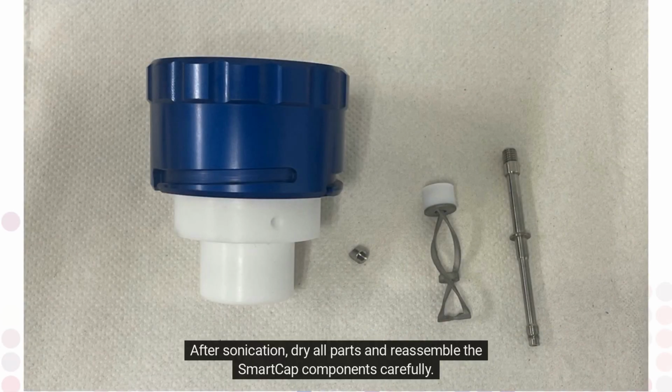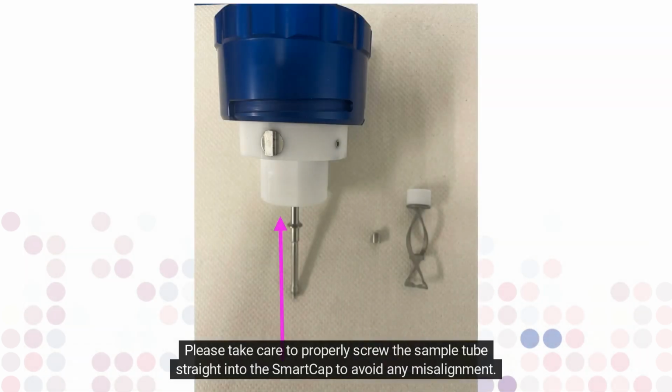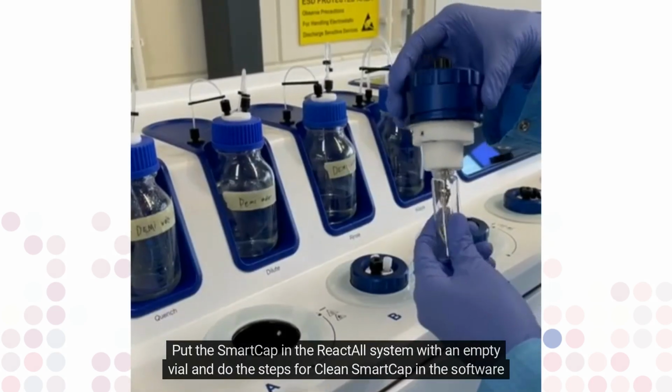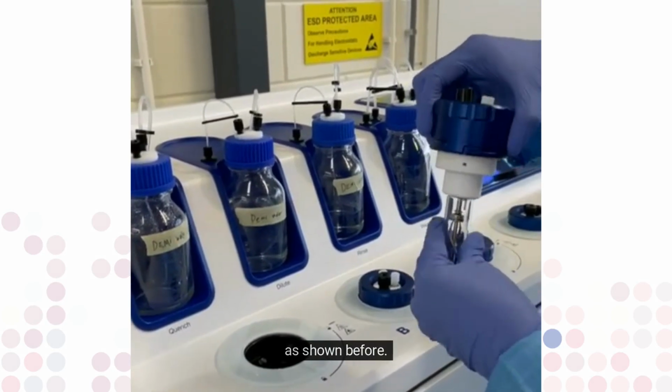After sonication, dry all parts and reassemble the SmartCap components carefully. Please take care to properly screw the sample tube straight into the SmartCap to avoid any misalignment. Also reassemble the overpressure cartridge holder and plugs. Put the SmartCap in the ReactALL system with an empty vial and do the steps for clean SmartCap in the software as shown before.